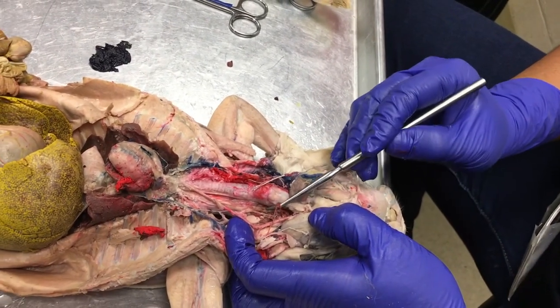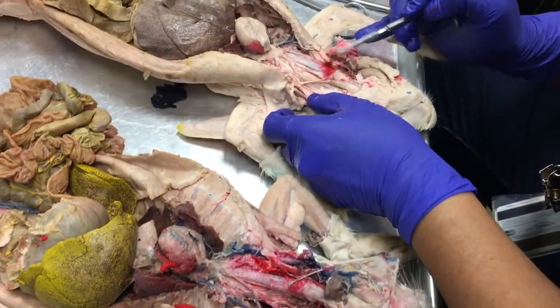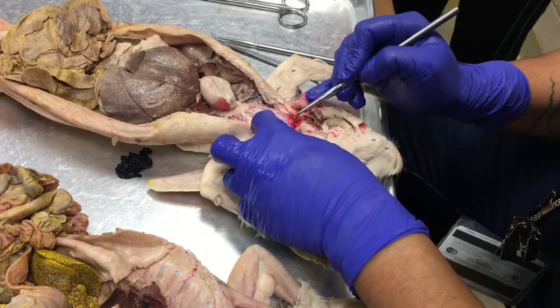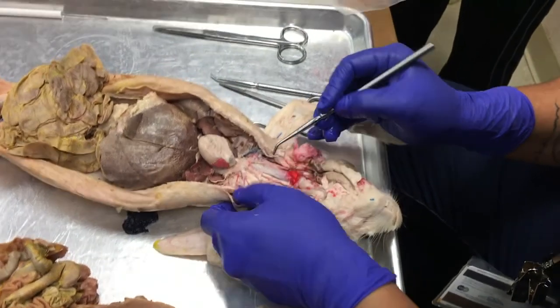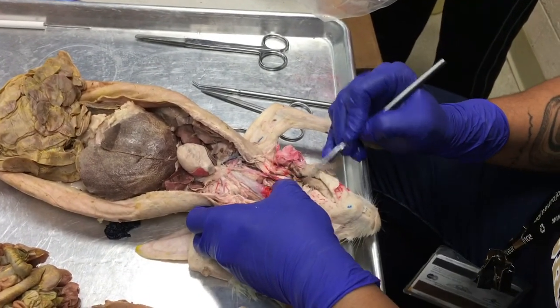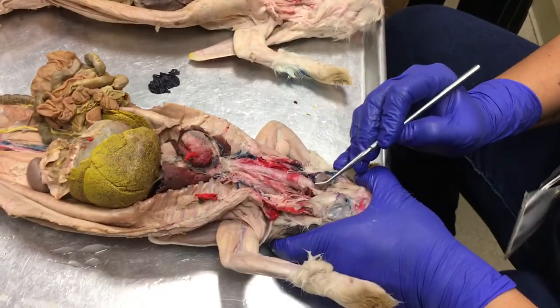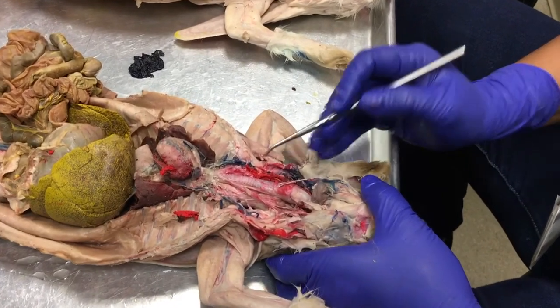Okay, so my internal carotid artery is not that great. I couldn't even find it on this one. So don't break it if you use my bunny. See that it's broken here on this side, way down here. And then it's just messed up here. So we'll just go with mine. All right, so internal carotid, external carotid.